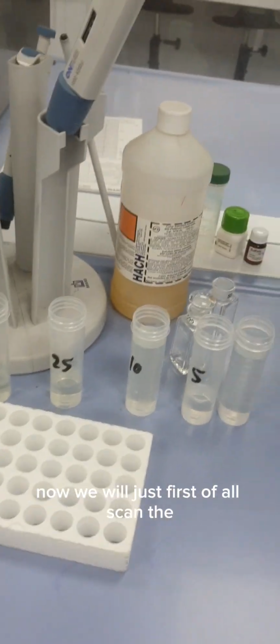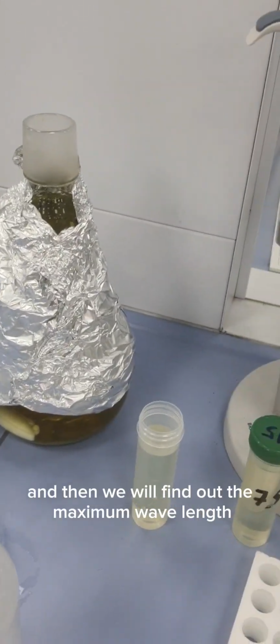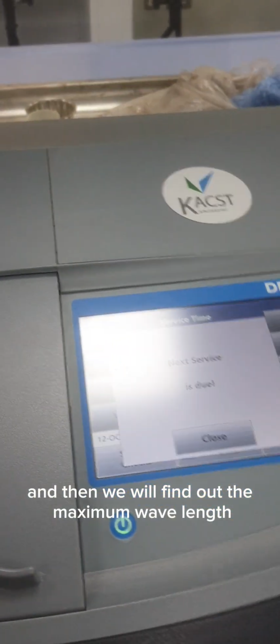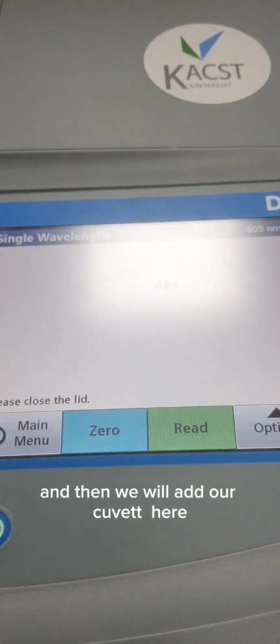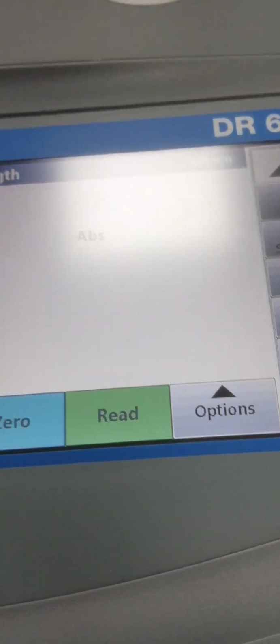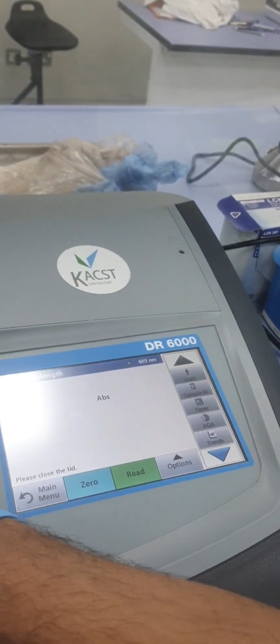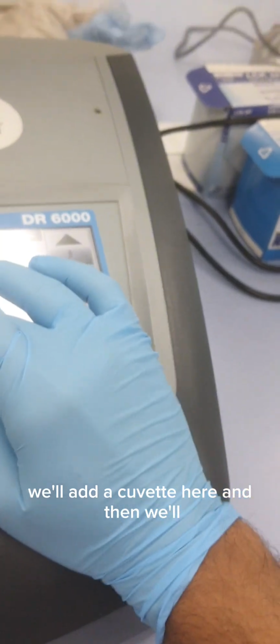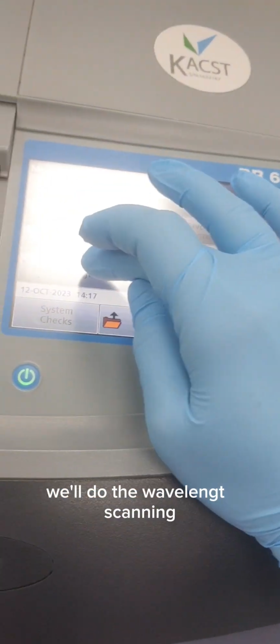Now we will first of all scan the tetracycline. We'll use the higher concentration and then find out the maximum wavelength. We will press single wavelength and then add our cuvette here. This is our cuvette. Make sure there is no thumb impression. We'll add the cuvette here, and then we need to come out. We first have to not do the single wavelength; we'll do the wavelength scanning.